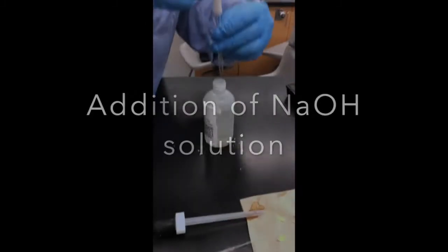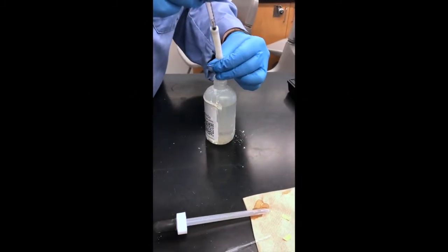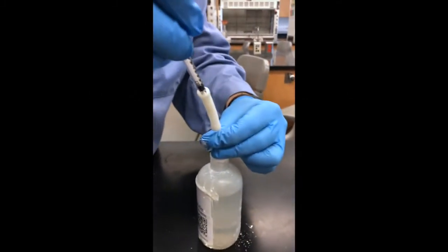Eventually we continue shaking and notice then, from left to right, what's happening to the pH is the colors going from blue to green to yellow. This means that the reaction is releasing acid back into the solution and lowering the pH, neutralizing the base and any remaining amino acid. So now it's time to add more sodium hydroxide to our solution.